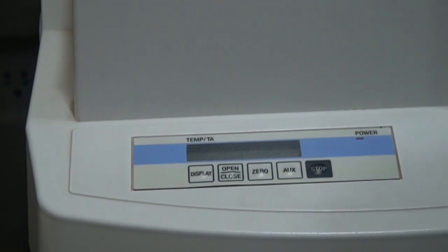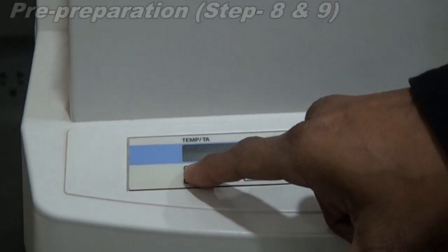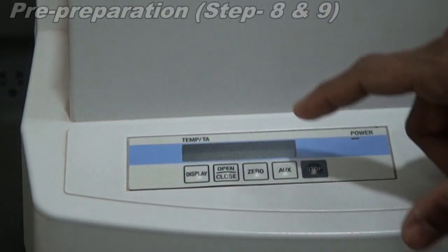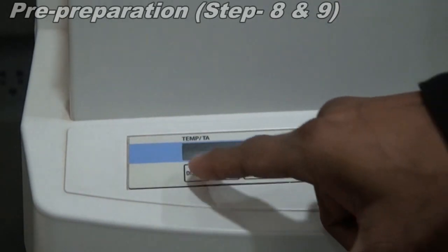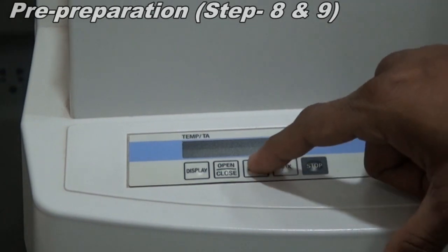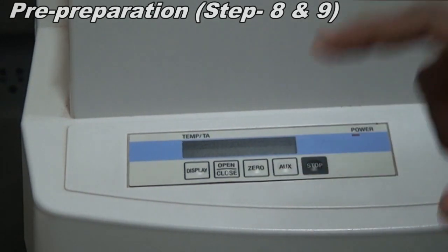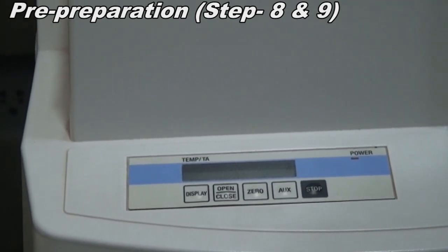whether the weight of the sample is 0 or not. For that we just need to click on this display button. Okay, it's showing some error value, which we need to make 0, and one more press shows the DTA signal, which we also need to make 0. If it is not coming to 0, I suggest you wait for 1 to 3 minutes.